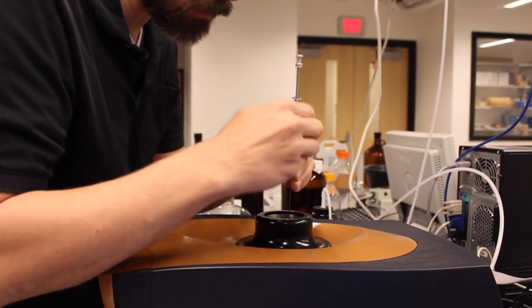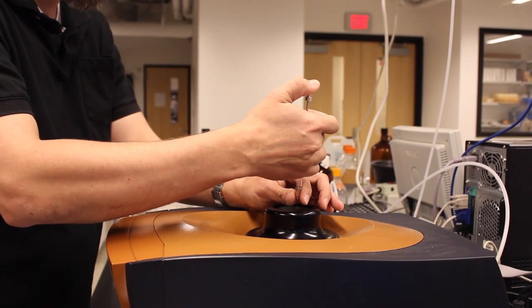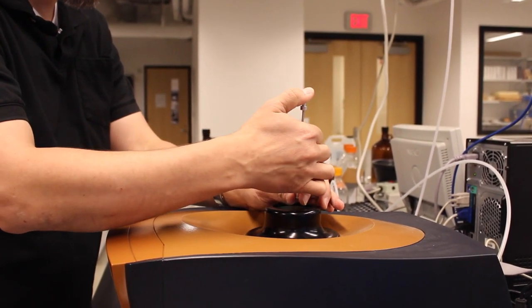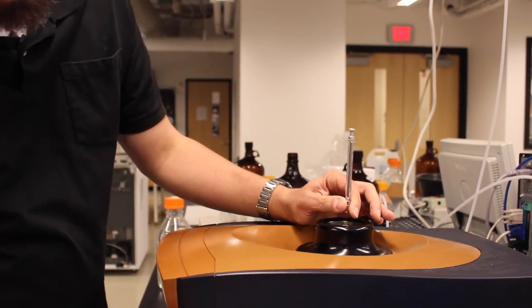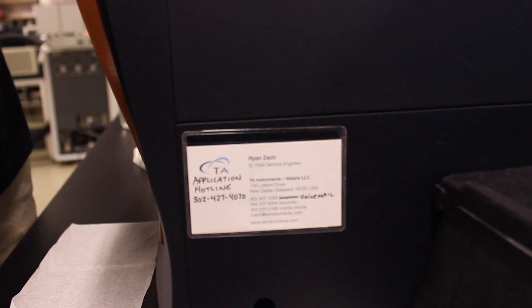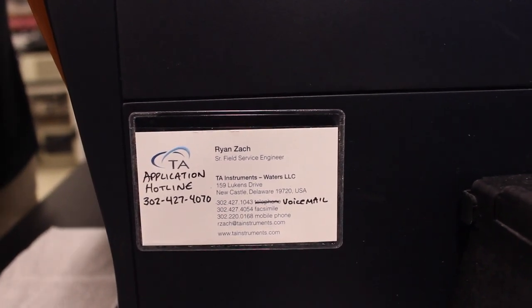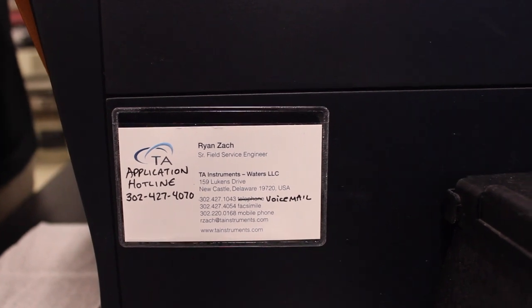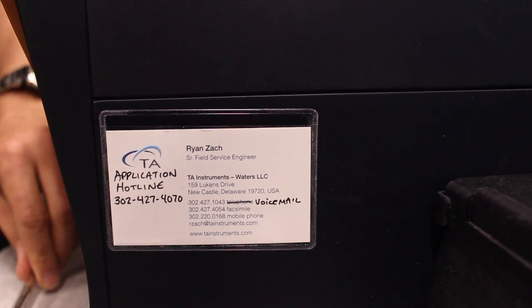I would recommend discussing these sorts of questions with an applications expert at TA Instruments. There is contact information here on the side of the instrument where you can email or call to ask questions such as concentrations of materials and any more advanced procedures.